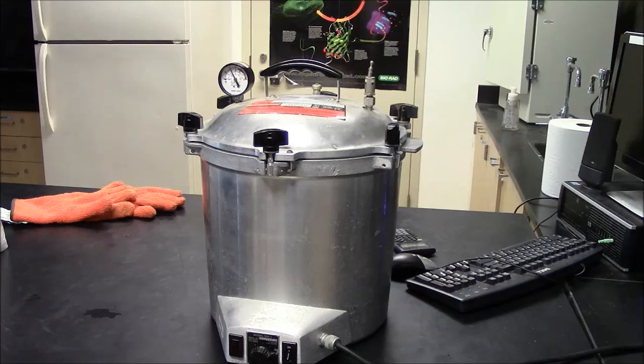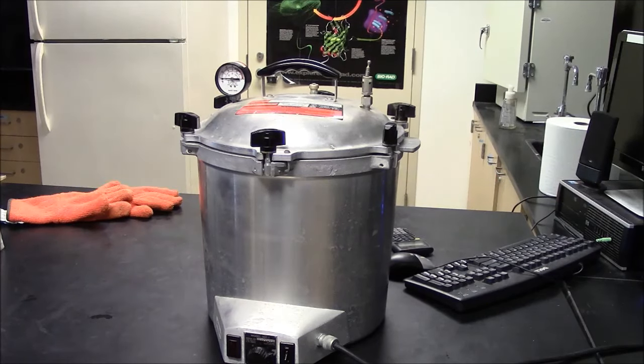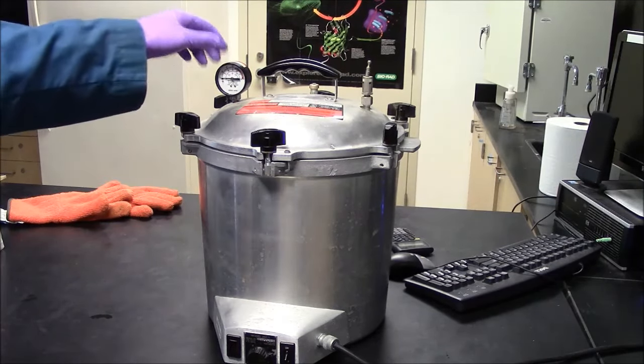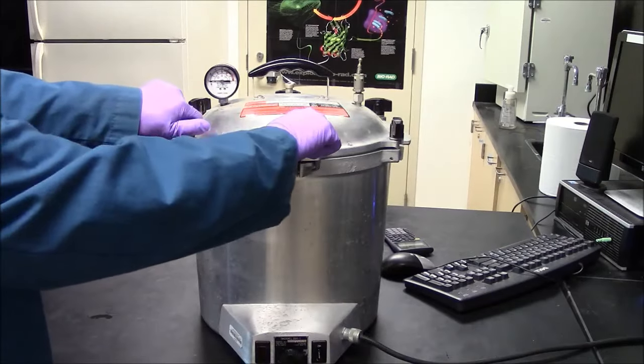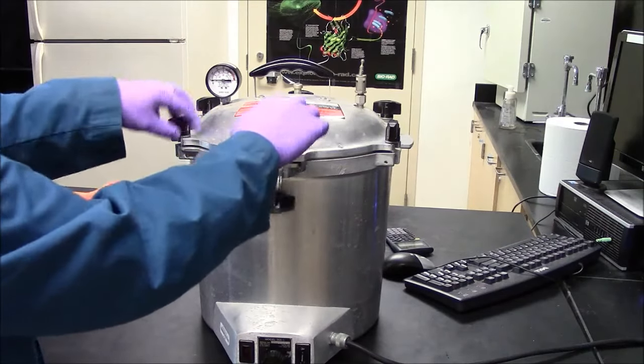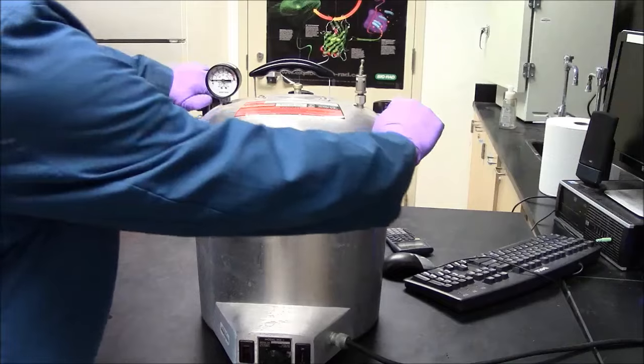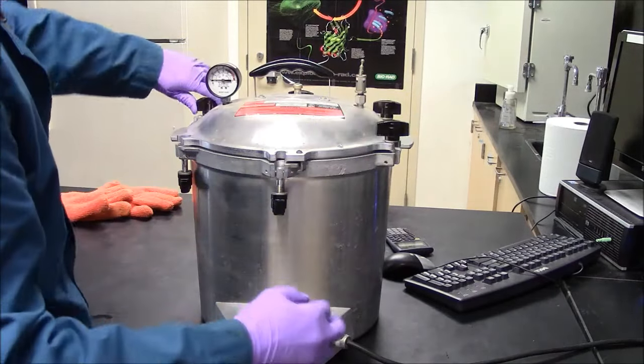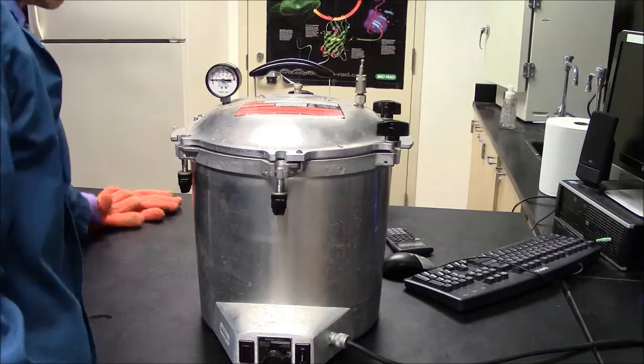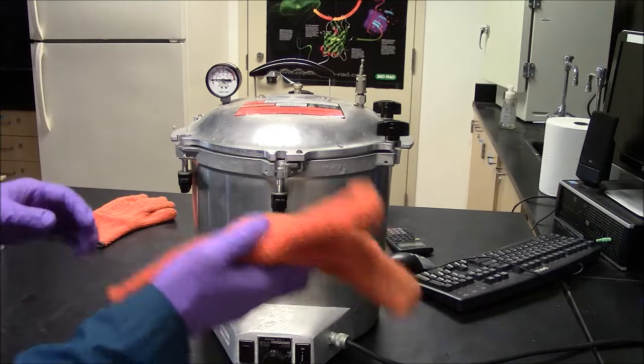But it does take a while to get back to one atmosphere. Everything's hot. So now the pressure is back down to one atmosphere. I can open this carefully. This is still very hot, so these gloves might be helpful.